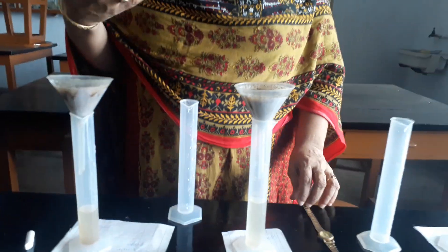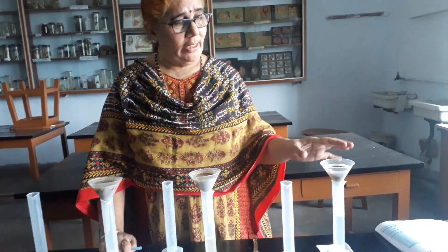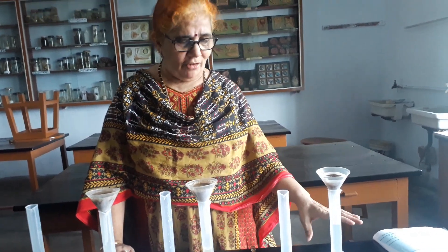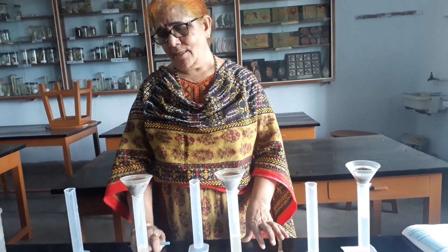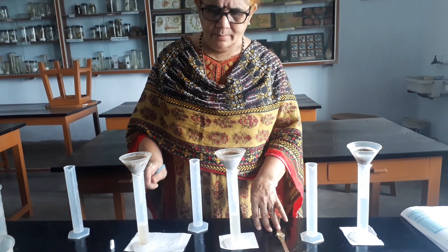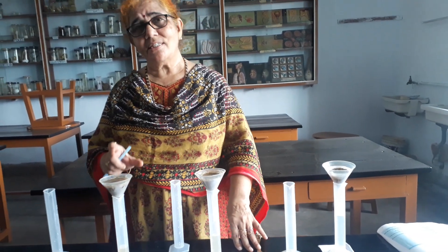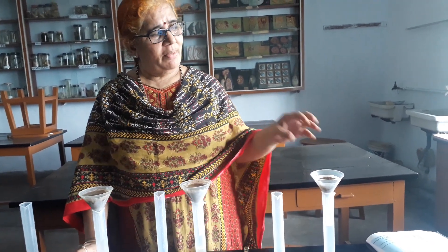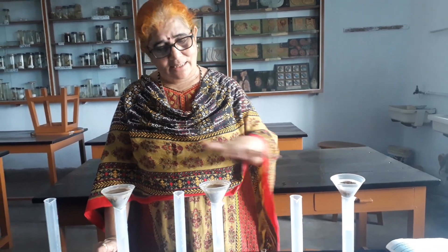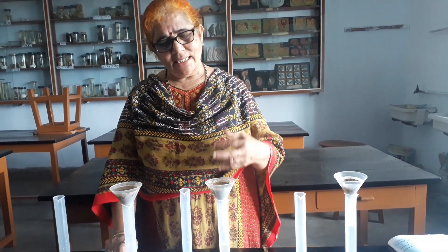So what is the conclusion of this experiment? The water through silt is falling not very fast but slightly fast. If you see clay, it is taking maximum time — even after a 10-minute interval it is only showing 22 ml. So our observation is: first, maximum water holding capacity is clay; next is silt; and minimum water holding capacity is sand. The result is: water holding capacity of clay is higher than silt, and silt is higher than sand. Thank you.